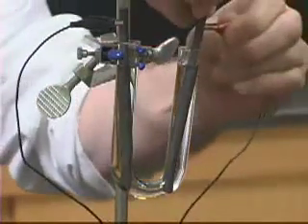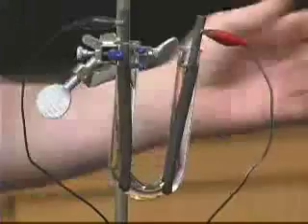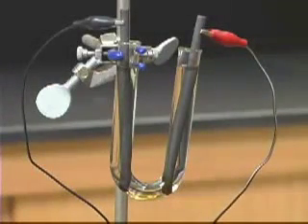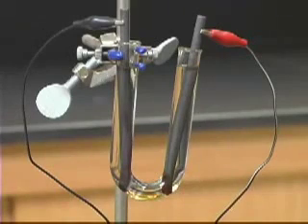We're going to pass a current through the system. The potassium ion is not easily reduced. The water is going to be more easily reduced.